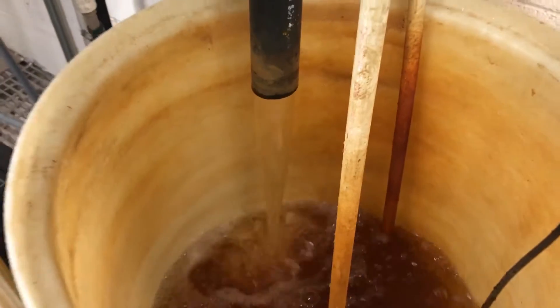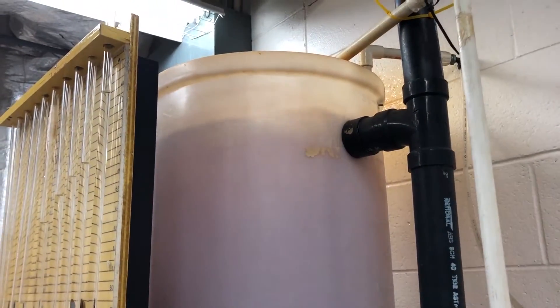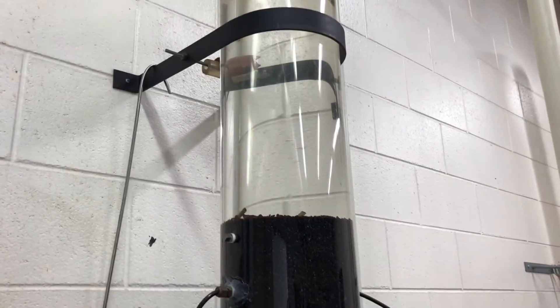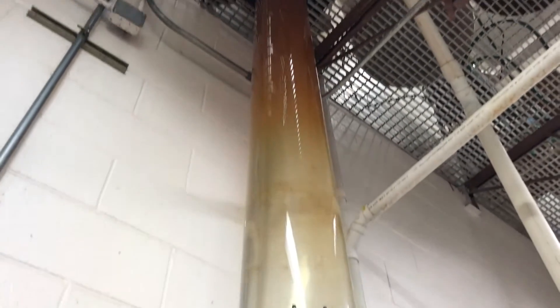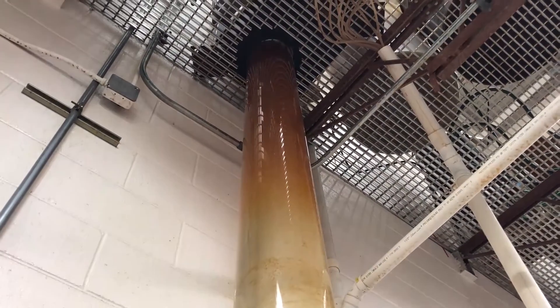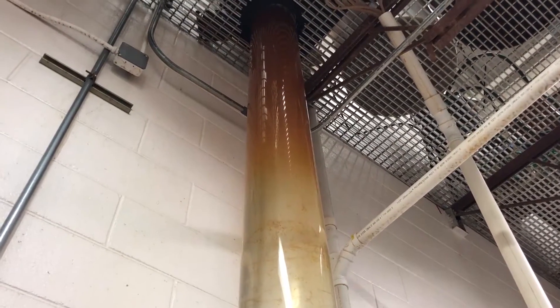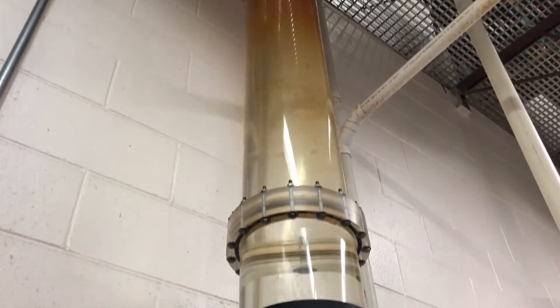There's another pump at the bottom of this barrel that sends the water up through this white pipe to the top, and it flows back down that drain. This is continuously recirculated so that the feed level at the top always stays the same. At the very beginning of the experiment the water is clear, but we have flocs beginning to come down — here comes the flocs.